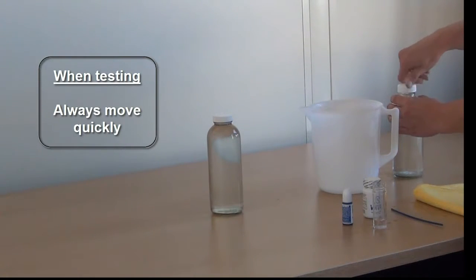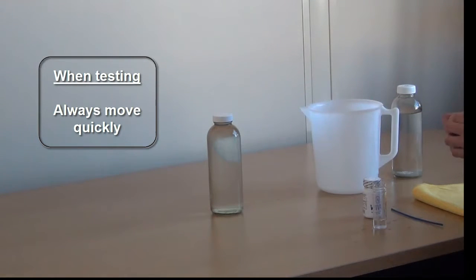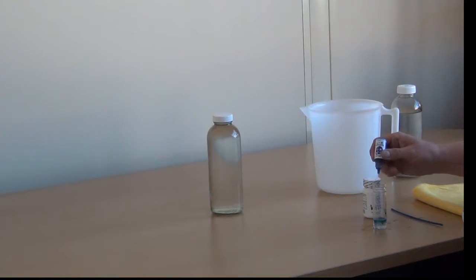When testing for hydrogen in water you will need to move quickly. The hydrogen dissipates. As I add drops, the water turns blue and then goes back to clear.